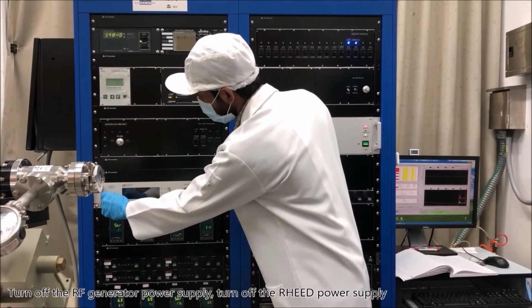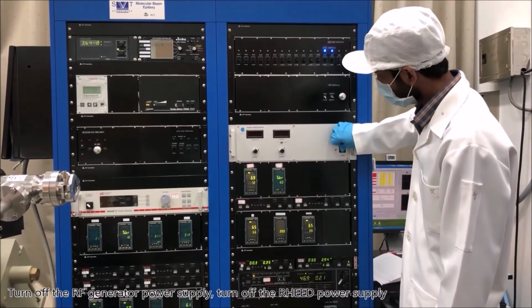Turn off the RF generator power supply. Turn off the RHEED power supply.